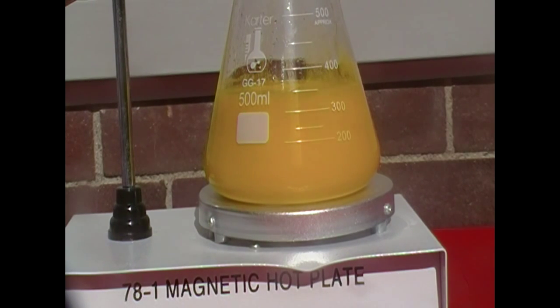Now for this part of the experiment, I'm going to do a time lapse because it takes quite a bit of time to do. And frankly, I don't want to bore you with 20 minutes of me heating and stirring the solution. You could be doing something good with your life in those 20 minutes, so I'll shorten it. You are all very welcome.